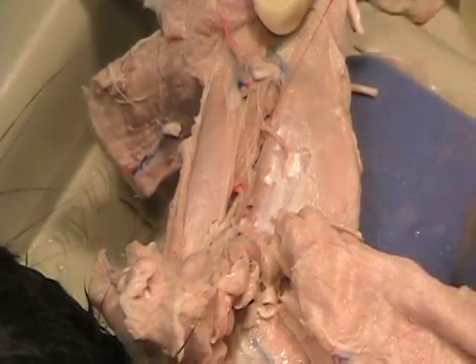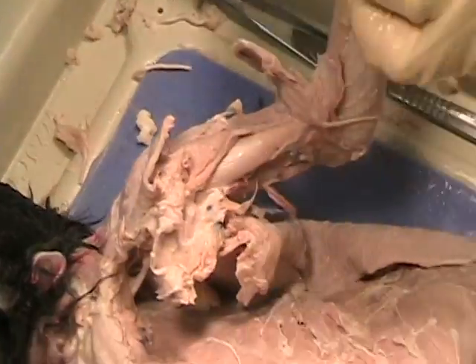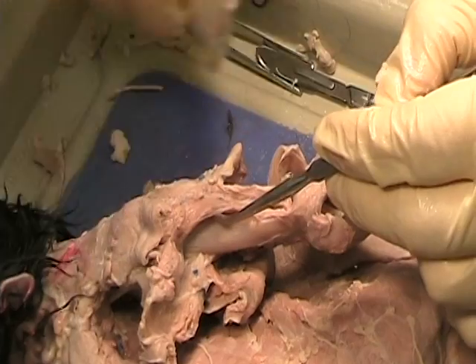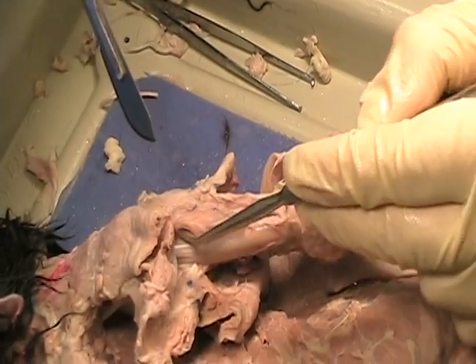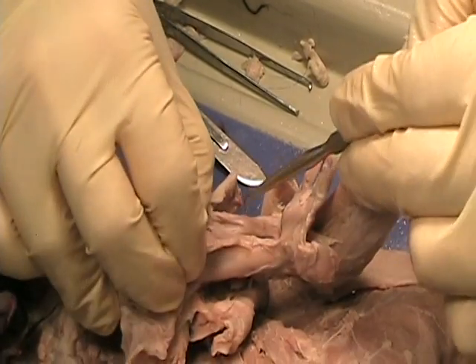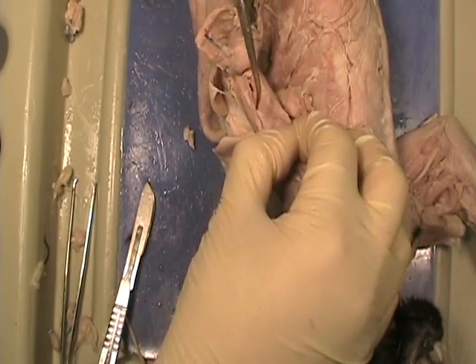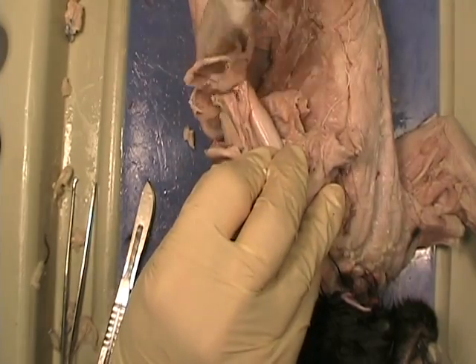So we're cutting the pec and the clavobrachialis out of the way. Now we can see — here's our biceps running all the way up here. Right next to that is the brachialis. Biceps, brachialis — they're side by side. So they're both flexors. Biceps, brachialis, side by side, and they're both flexors. You're going to flex the arm at the elbow, so you should be able to see them work opposite the triceps.